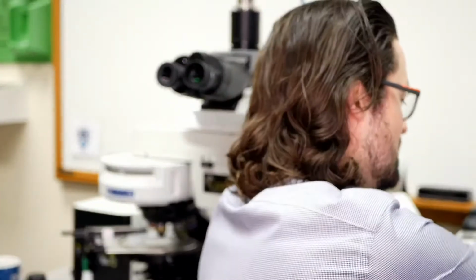What's better, and what we get really excited about at Leeds, and what we most often sell on our comparison microscopes now, are LED light sources. And so I have an example right here, and this is what we most often sell. We still sometimes sell halogen light sources for our comparison scopes for labs that want to keep that or have trained and worked extensively just with that halogen light and that color rendering. But more and more often we're selling our LED fiber optic illuminator.